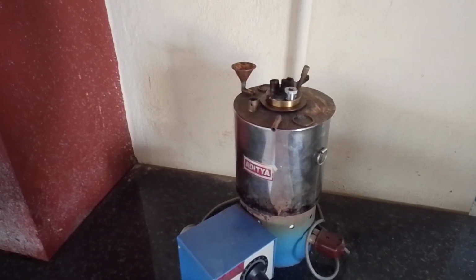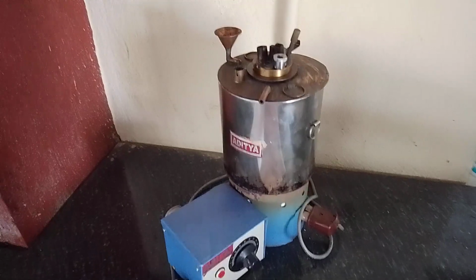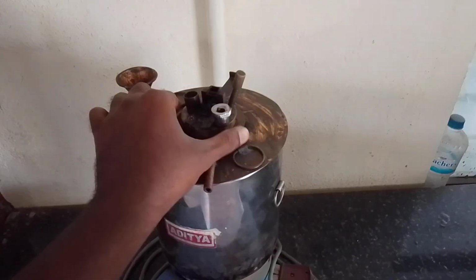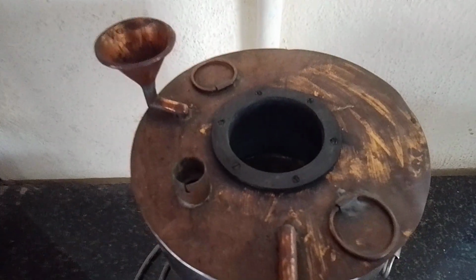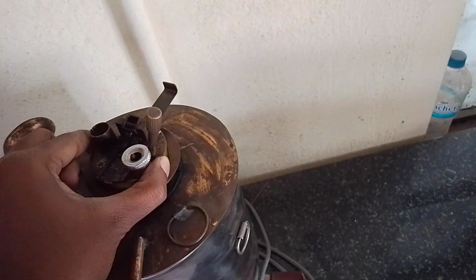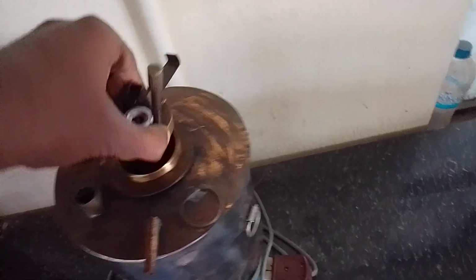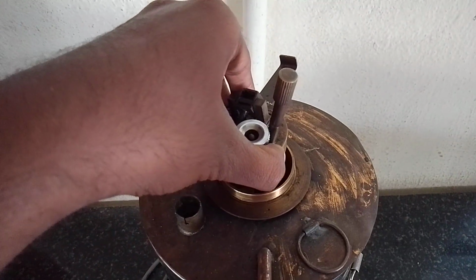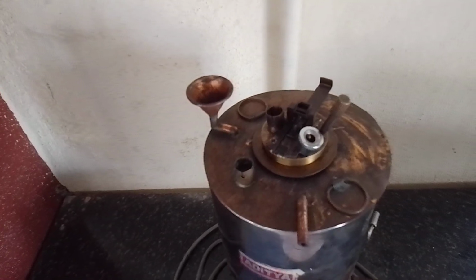Now we will look at the apparatus details of this experiment. Here you can see the place where you are going to store water in a water container. We pour water into the container, and this is a small container which I removed now. Inside this you are going to store kerosene. This Abel Pensky is being used to find the flash and fire point for kerosene.